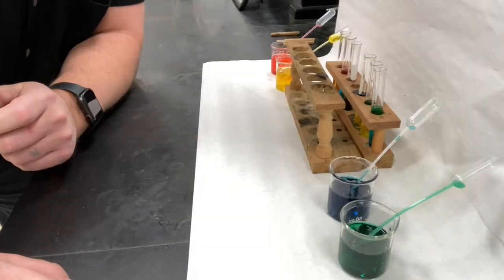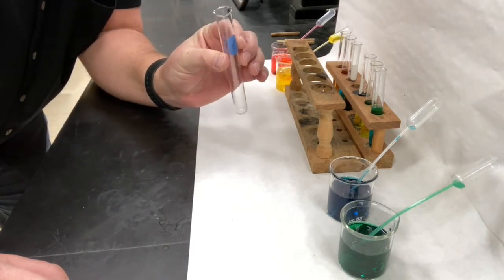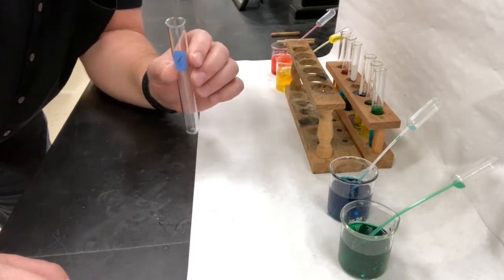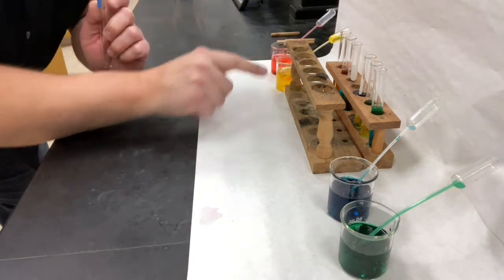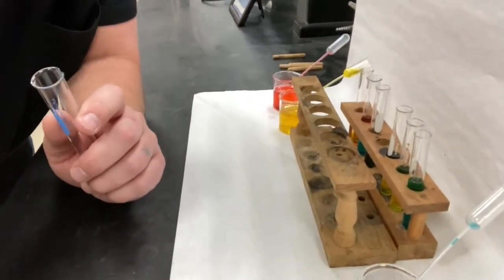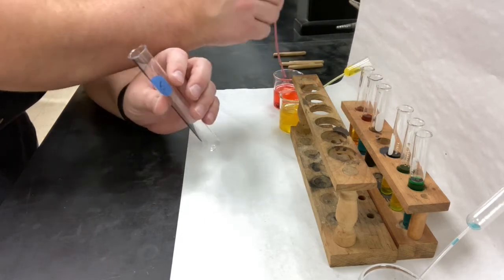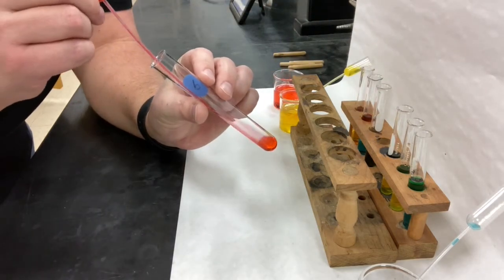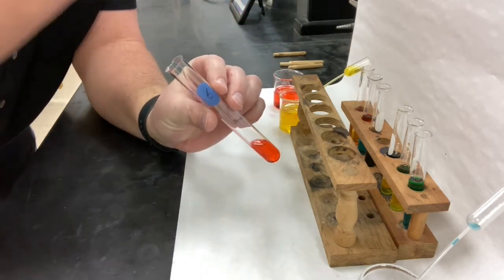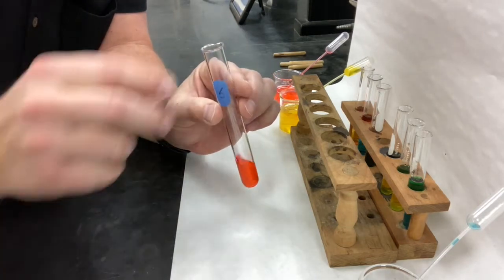Okay, so I'm going to go ahead and add all 4 to one test tube. I'm going to use a larger test tube this time because, as you can tell, all 4 might fill up one of those smaller test tubes a little too much. So I'm going to put them in order. Red first, yellow, blue, and green. That's the order we kind of tested things in. Doesn't mean that's the order they're going to stack up in the column, but if density holds true, it shouldn't matter. They should separate into their own layers. Okay, now I'm going to use 2 squirts so that we get a little more coverage.